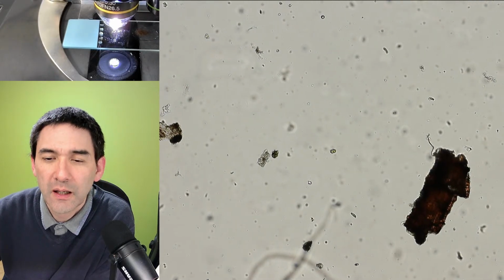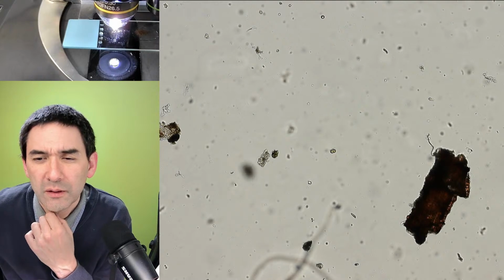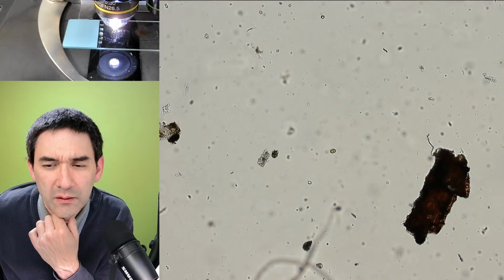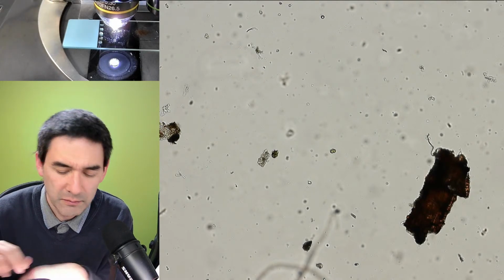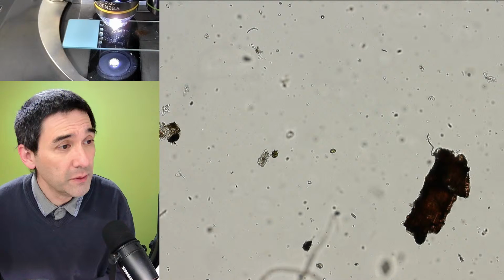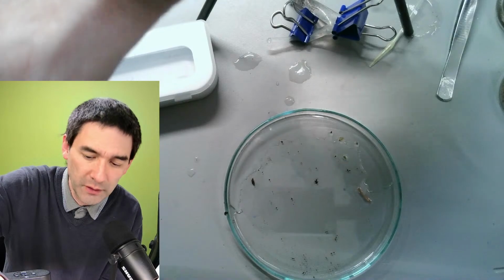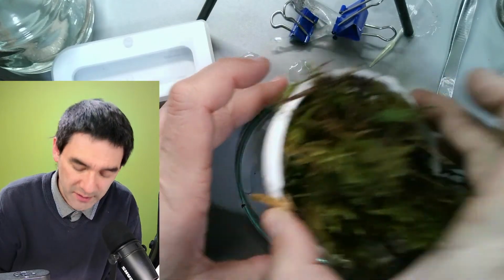I mean, using a coarse filter like the one you have. You mean why can't we use a funnel with a filter instead of the entire Baerman funnel? Just use a funnel with a coarse filter. I don't entirely know what you mean. Are you talking about the sieve that I have over here? Yeah, the sieve itself. Okay, maybe this is what you mean. Look, I'll just show you. Maybe you mean something like this. That should maybe also work. Why not try it out? Why use a whole funnel if you can also try something like this? This is going to be messy.